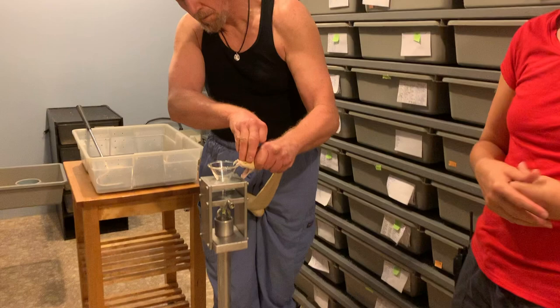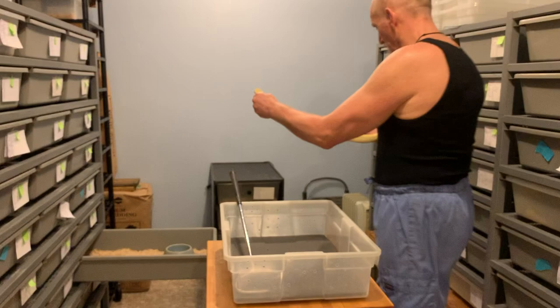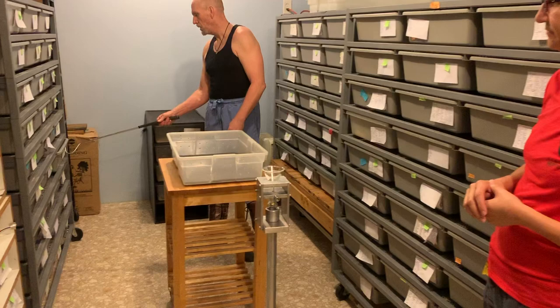This one is an albino. The venom is the same — it just came out of one of the bloodlines we had from Texas. It's kind of interesting looking. We have a couple, I think, in the group.